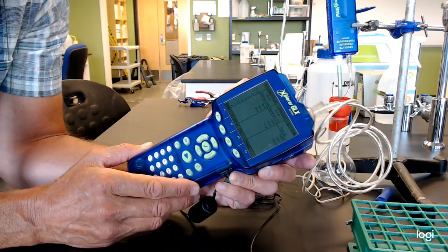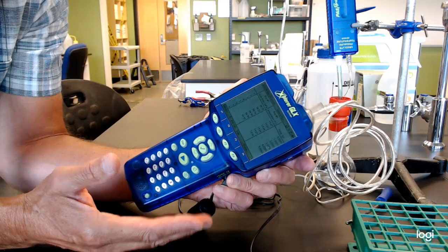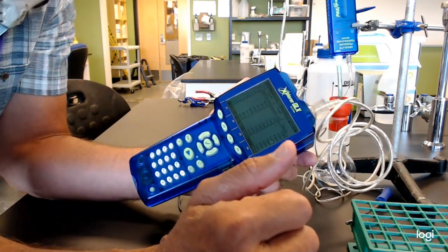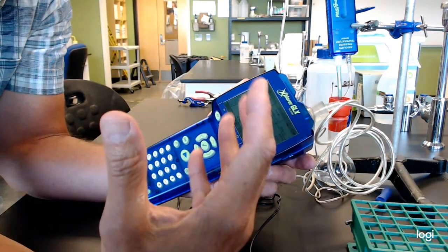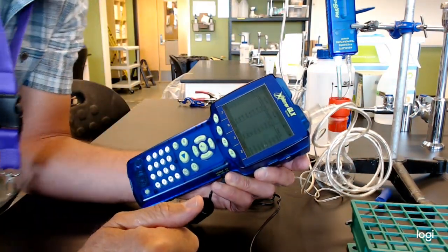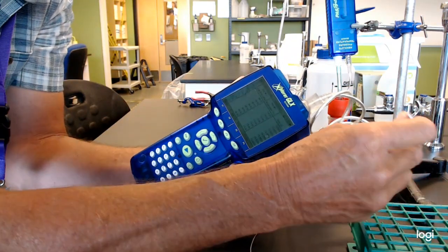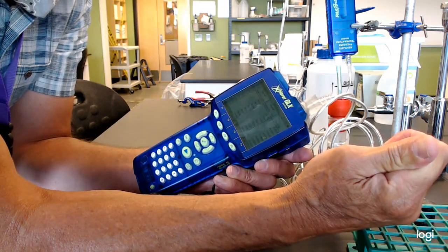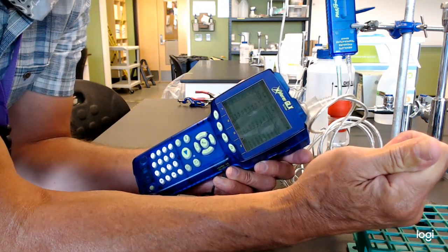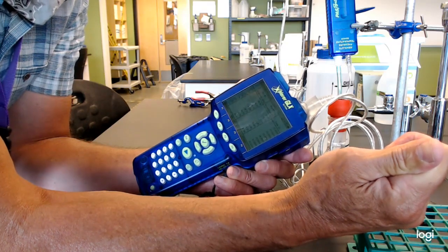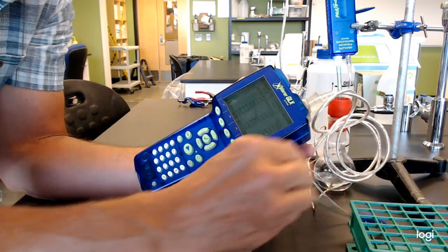And here you go. One thousand one, one thousand two, one thousand three, one thousand four. As we set it up, earlier it would have been 10 every second, so we'd just be scrolling down the screen, and that's just way too much data for this. If you want, we can give it a little variation. Make sure things are making sense. The room started off about 20, now it's heating up. That all makes sense. So everybody's happy.